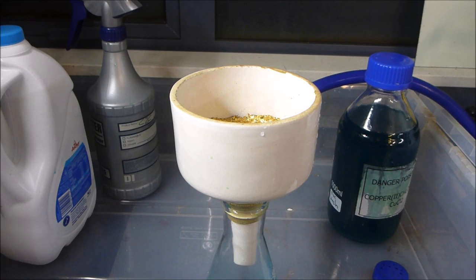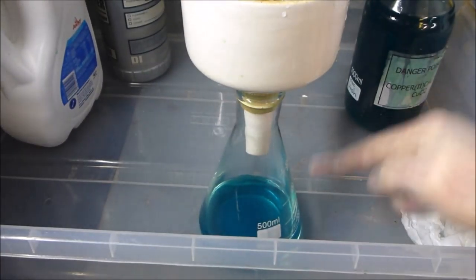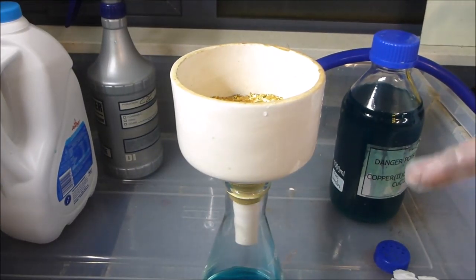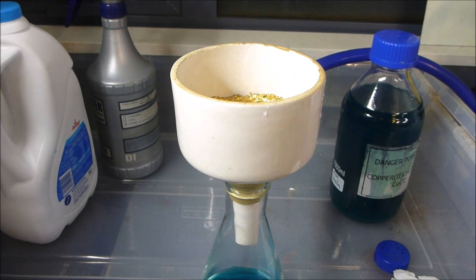Okay guys, so I've just finished filtering the very last of the wash solution that I use to clean all the foils out of the bucket and stuff like that. Still using the same filter as I started with, and this was by far the easiest, simplest, cleanest AP filtering process that I've ever been through in all of the years, and I've done this many, many times. So yes, this was an absolutely fantastic idea.